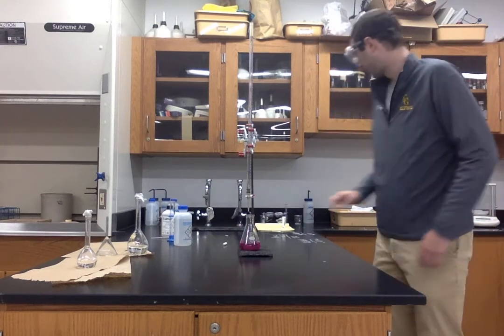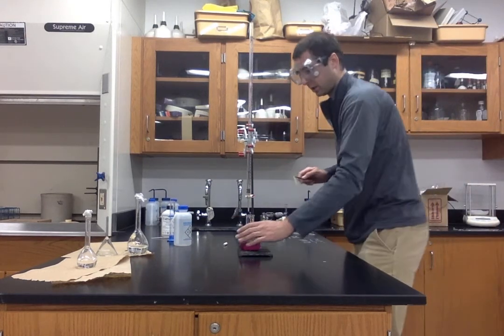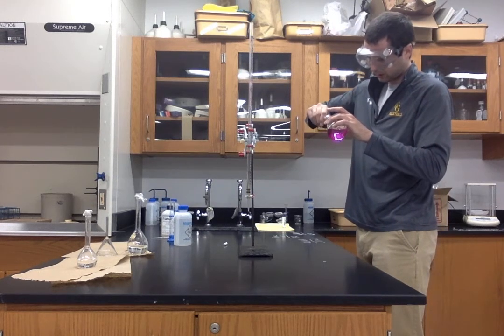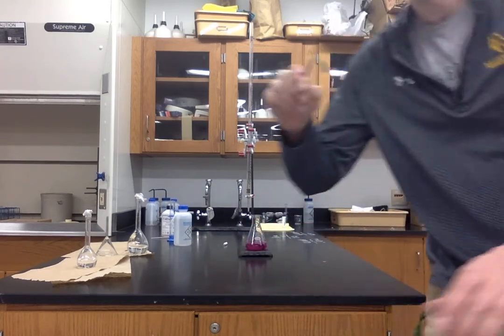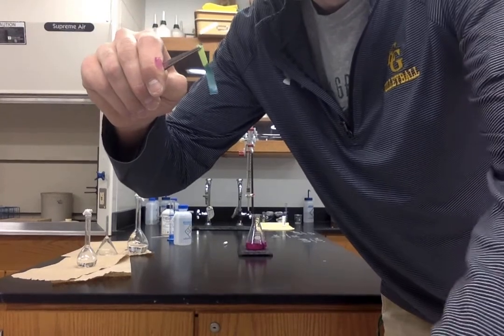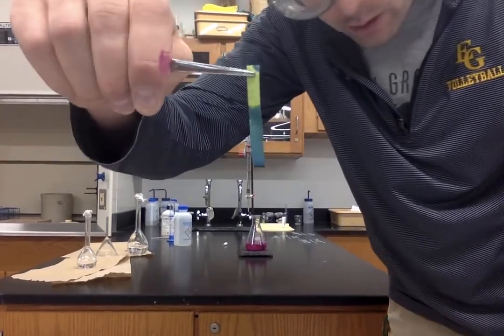And let's take our final pH test. And what do we see? Boom. Blue again.